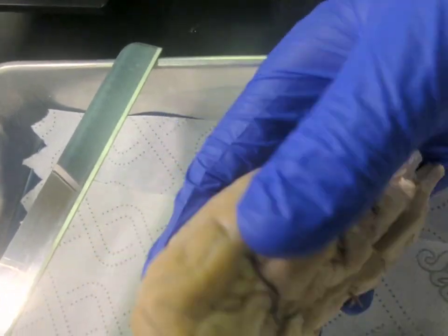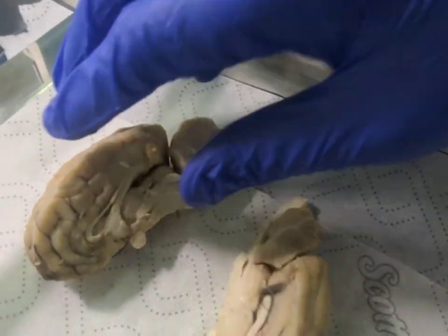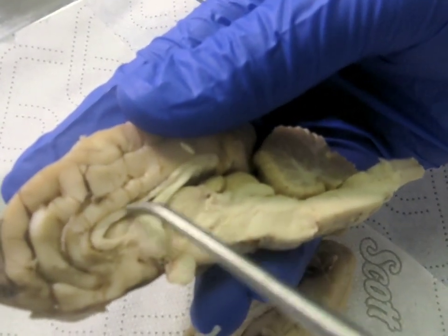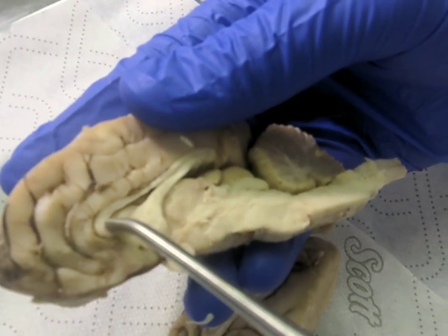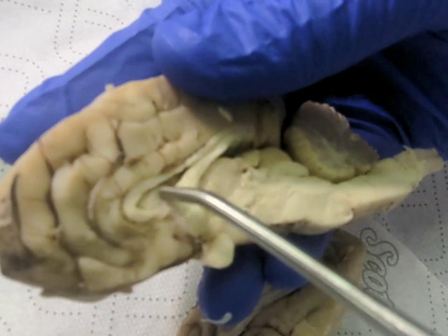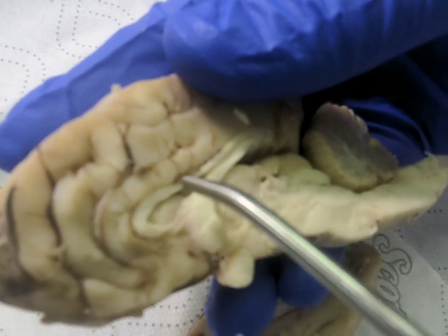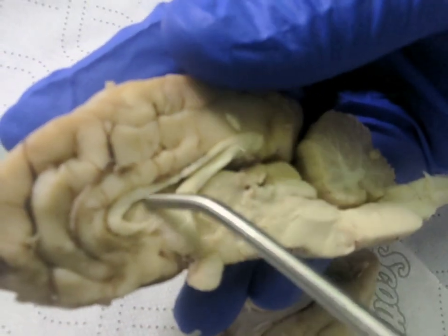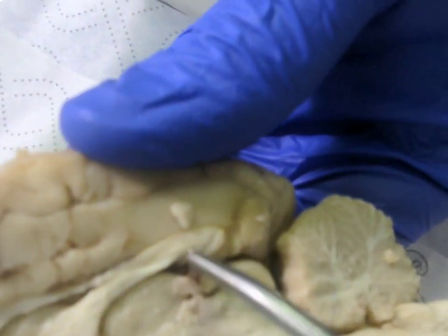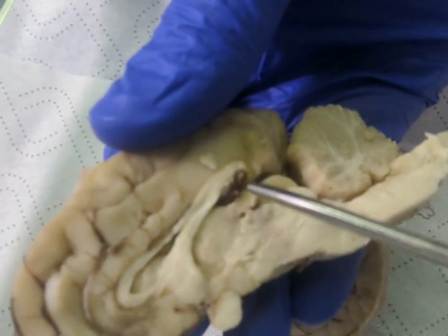And so now we're gonna look inside. This one's easier. So the corpus callosum is this layer right here, this top layer. This bottom layer here is the fornix, and the septum pellucidum is the layer between them, and it's what separates the left and right ventricles and allows for the passage of cerebrospinal fluid. And then of course the opening is the lateral ventricle, and this little pigmented strand hanging out is the choroid plexus, and that's where the ependymal cells are going to be located, which produce cerebrospinal fluid.